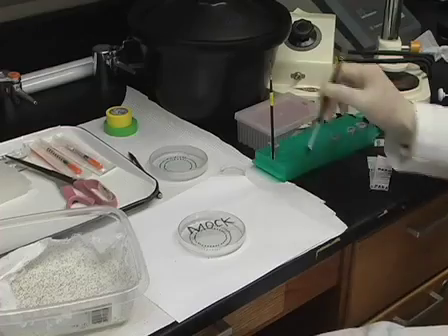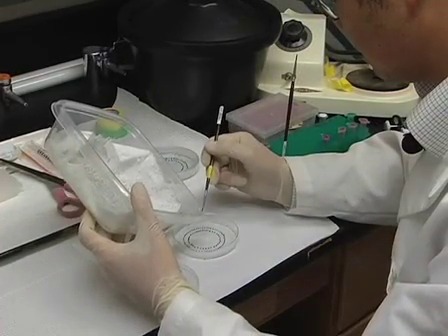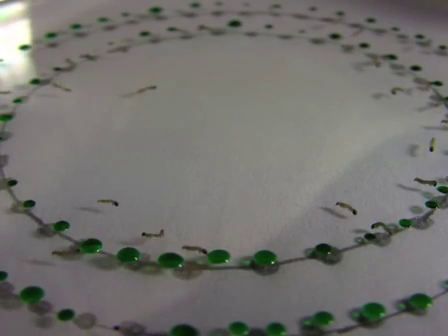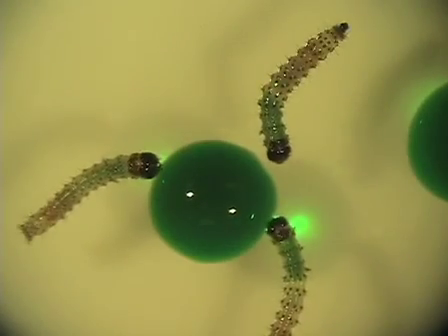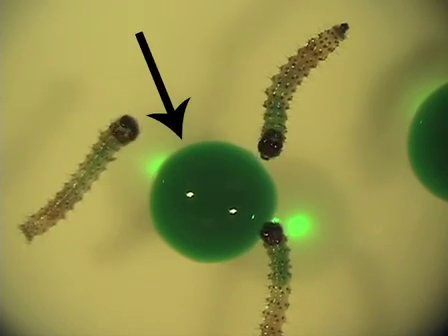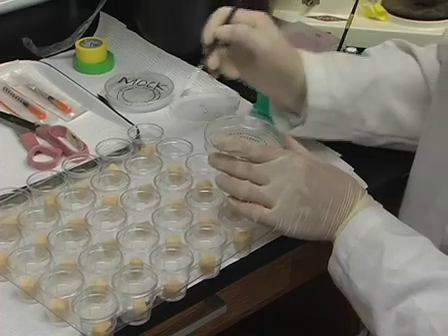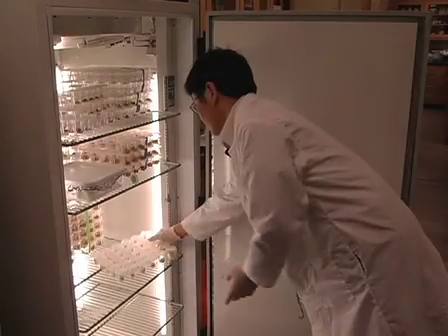Ideally, use different paint brushes for the transfer to each virus type to prevent contamination between treatments. Allow the dish to stand at room temperature for 10 to 15 minutes, during which time larvae drink the solution. Larvae that have fed can be identified by green coloration of the anterior gut, resulting from the green food coloring dye. Transfer only those larvae that have fed to 1-ounce plastic cups which contain diet. Transfer 1 larva per cup.